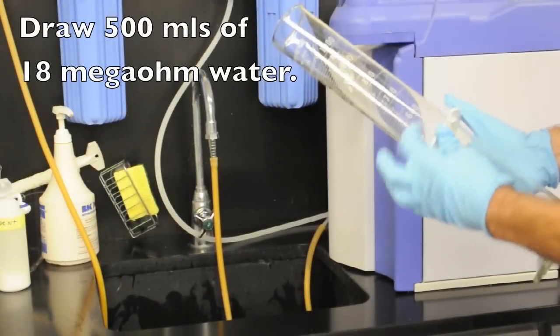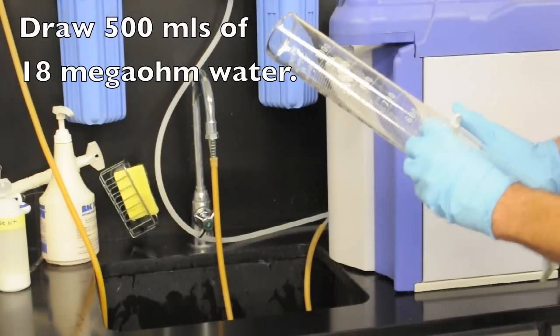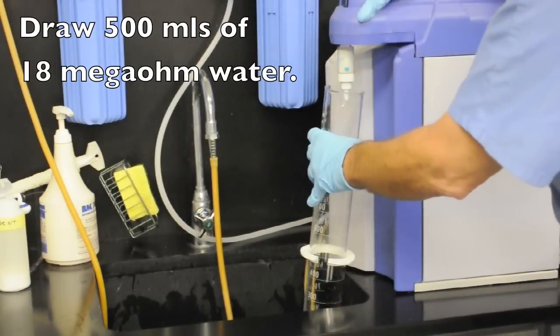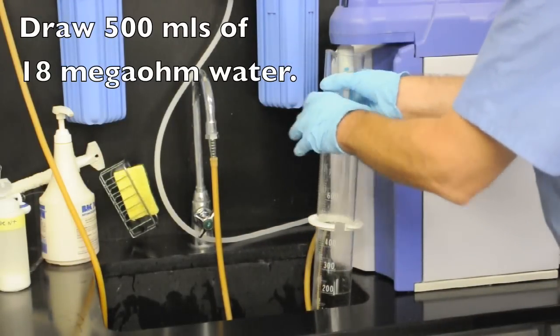Here we see the technician putting together a graduated cylinder. There is an indicating ring which helps us find the meniscus and makes it easy to do the measurement.